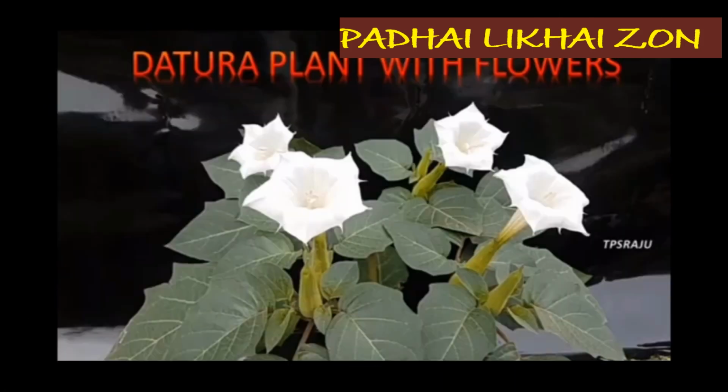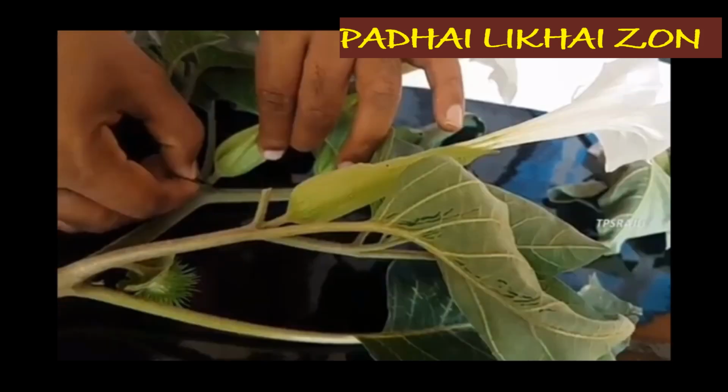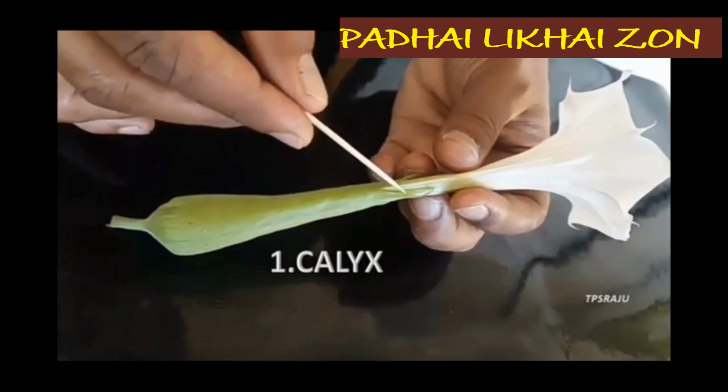So children, we select Dhatura flower from the family Solanaceae. Here is a Dhatura flower to study the structure of a flower. Cut the Dhatura flower for dissection. The flower has a stalk-like structure called pedicel. The upper swollen part of the pedicel is called thalamus. Flower parts are arranged on that thalamus.